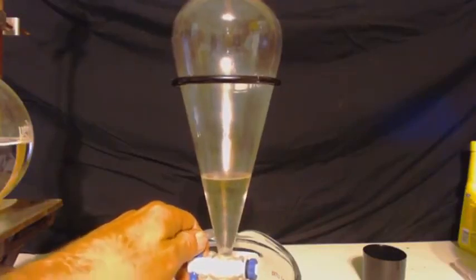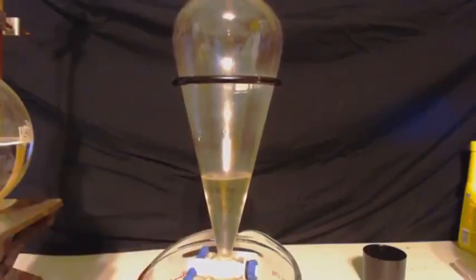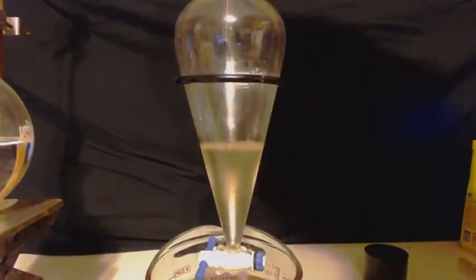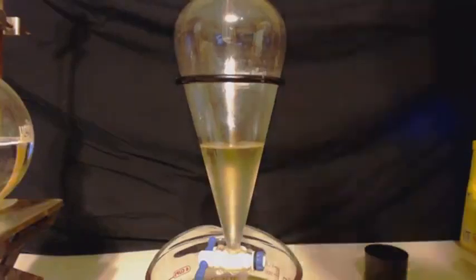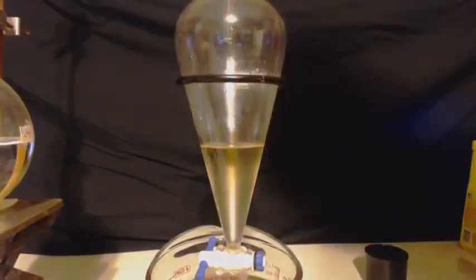So now I drained that out, and as you can see, I only have half the can here. So I'm going to go get the other half that I did, and we'll put both the halves together, and then that will be all of the hydrocarbons that came out, all the non-polar liquids that came out of that can right now.